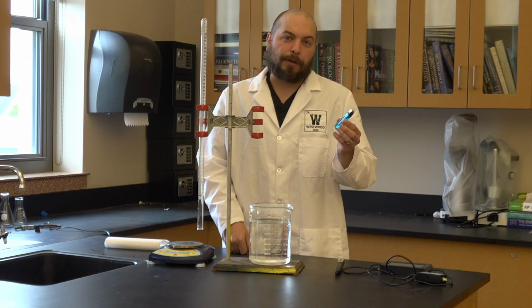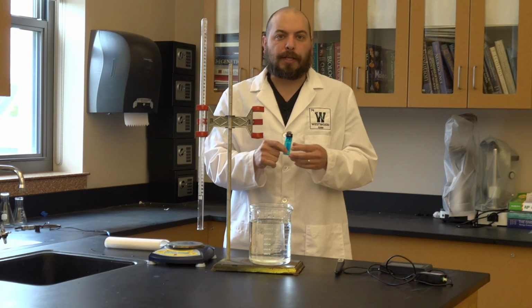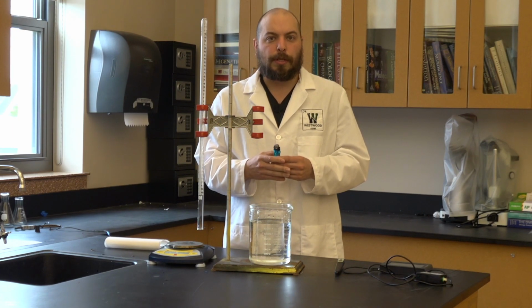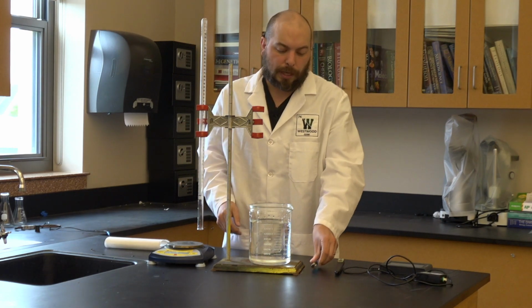We've got a butane lighter. The butane lighter contains the butane that we are going to have as vapor. Butane is a highly volatile chemical. What that means is it vaporizes very quickly and easily at low temperatures. This is good for us because we need to make sure it vaporizes quickly so that we can do this in a short amount of time.